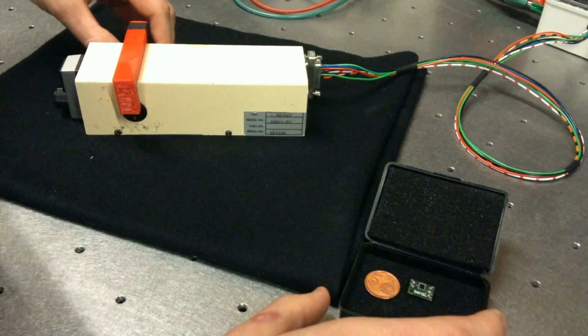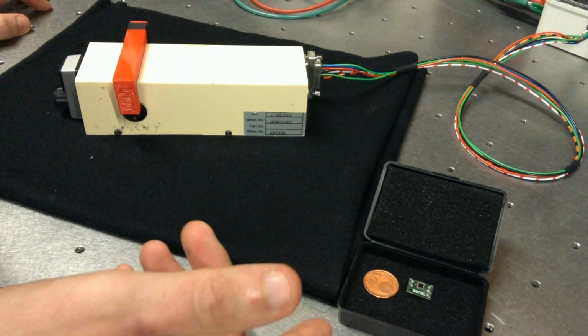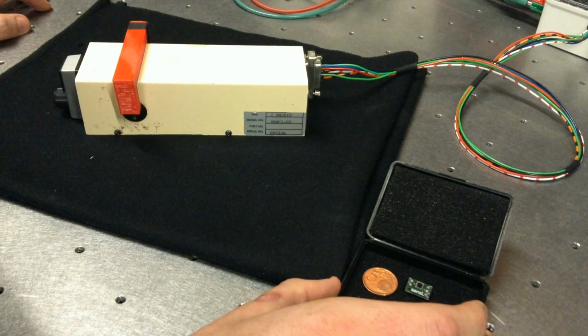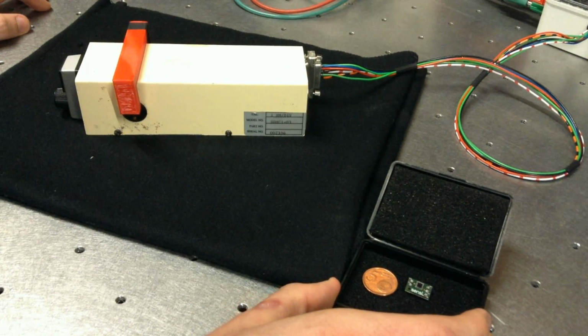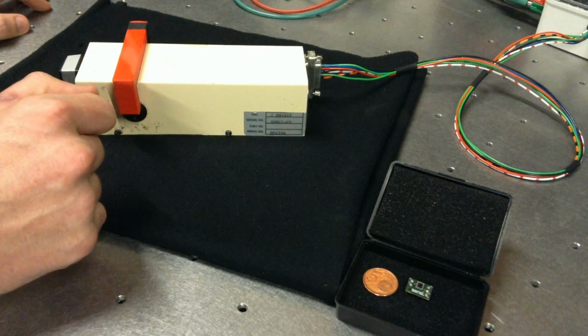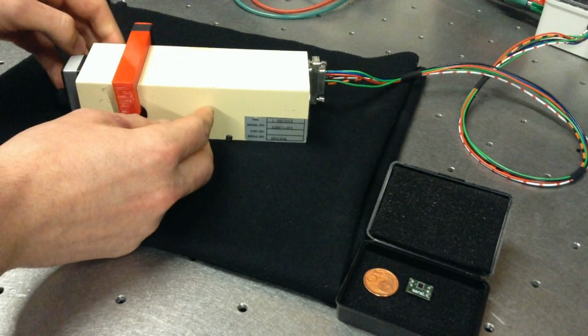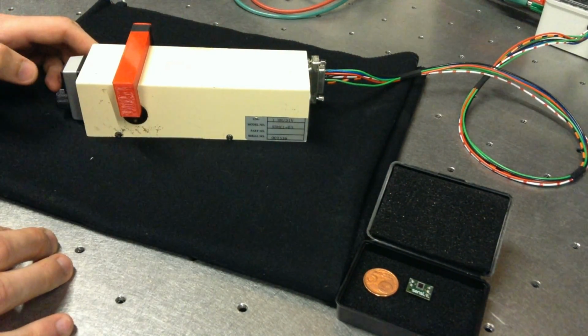This here is an example of that SiPM. The SiPM itself is a SensL C-series, and it is sensitive to light between 300 and 950 nanometers. The diffraction grating within the monochromator is controlled with the stepper motor on the rear of it here, and the diffraction grating has 1,800 lines per millimeter.